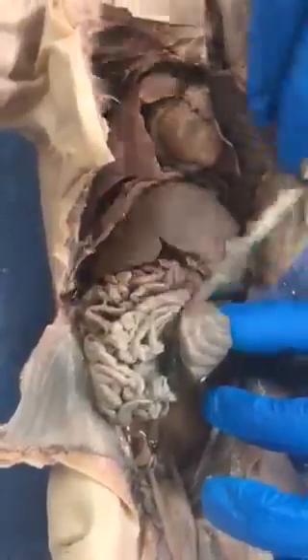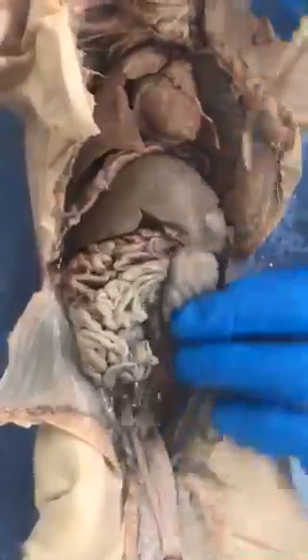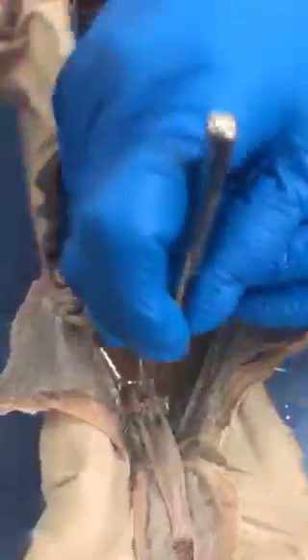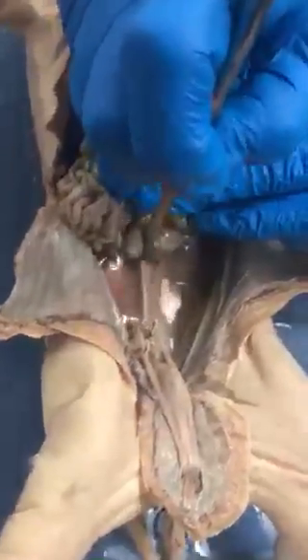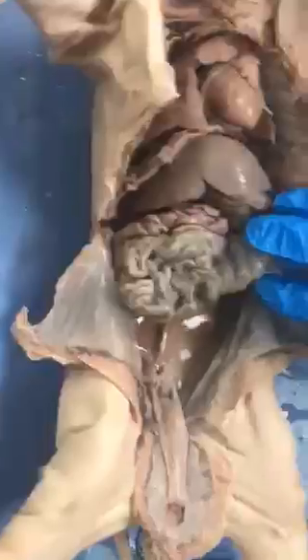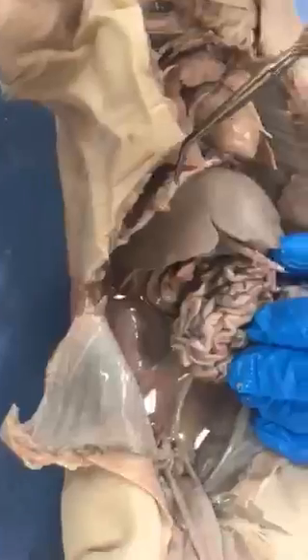and then the colon of the pig is the spiral. They don't have ascending, transverse, descending, all that stuff, so just colon. And then the very last part of the large intestine is the rectum, which is not exactly straight up and down here, but right here at the back. And these are the kidneys, which you don't need to know, but they're on either side of the rectum.